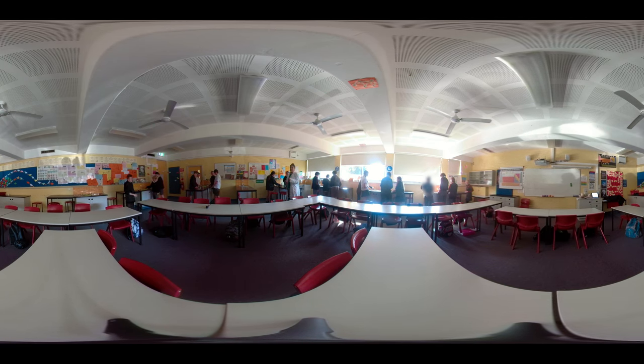It's going to shoot right up. Alright, well done Kiara. Okay, blue flame? And then we change it to a blue flame. So Year 6, the orange flame is a safety flame and the blue flame is our heating flame — it's the hottest flame.